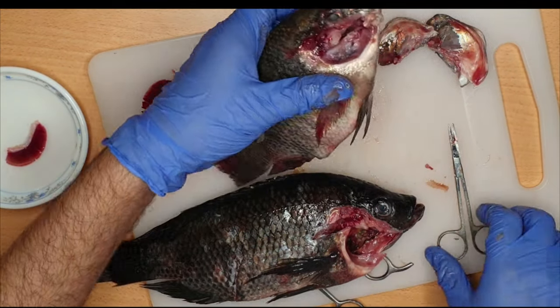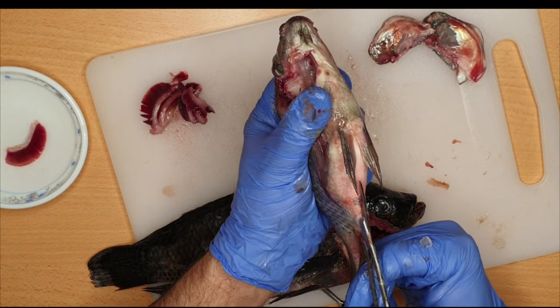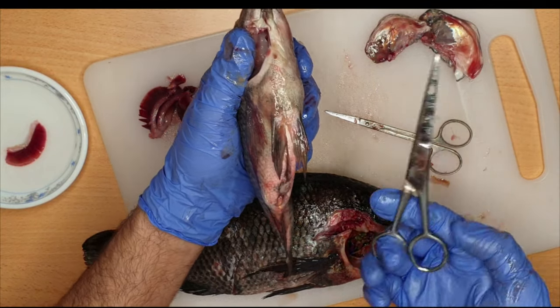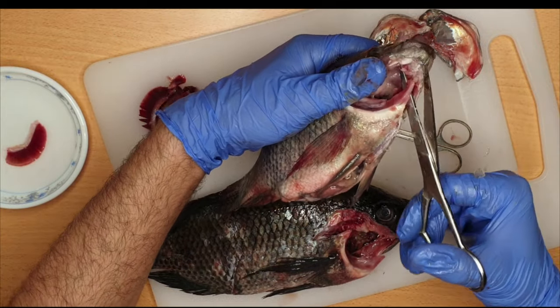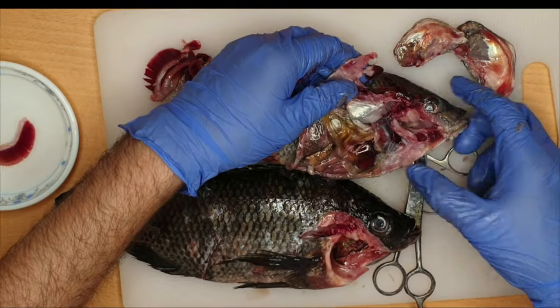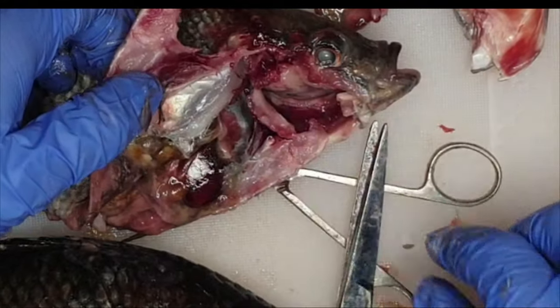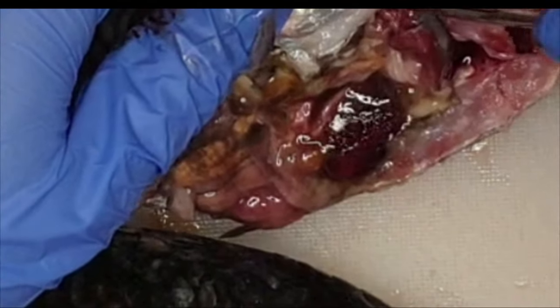If we open the fish starting from the anus opening and proceed carefully past the pelvic bone, going farther we will find the digestive tract. We have the mouth, after the mouth there is the pharynx, after the pharynx there is the esophagus, which leads to the stomach. Here we can see the liver. Let me clear the area to make it much more visible.